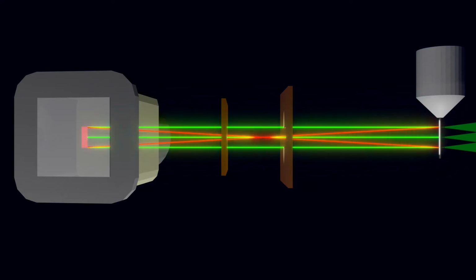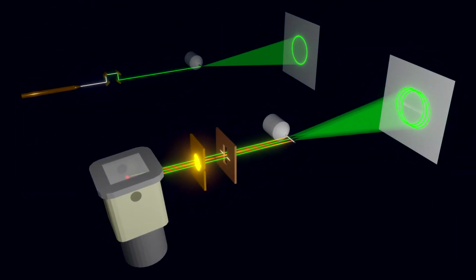The most extreme divergent rays are shown in red. These non-parallel primary rays further smear the diffraction signal, but we can block them in the primary beam by inserting Soller slits. This cleans up the diffraction signal a bit. We could also narrow the beam by reducing the beam mask, but that would cost a lot of intensity, so it is not ideal.